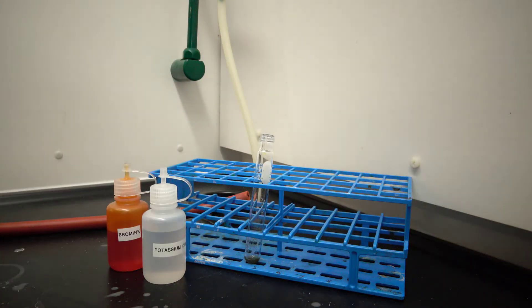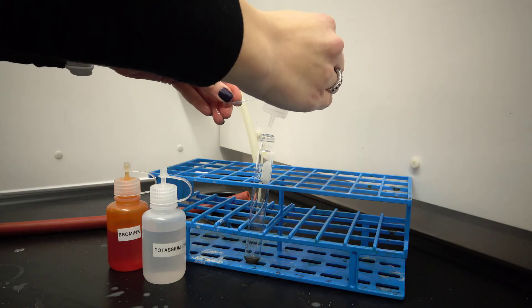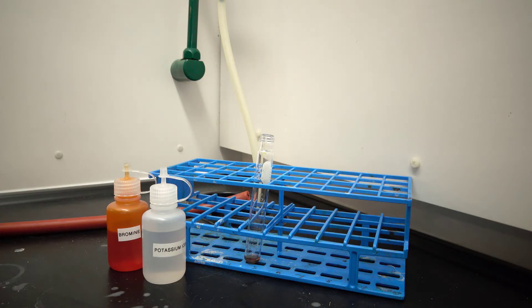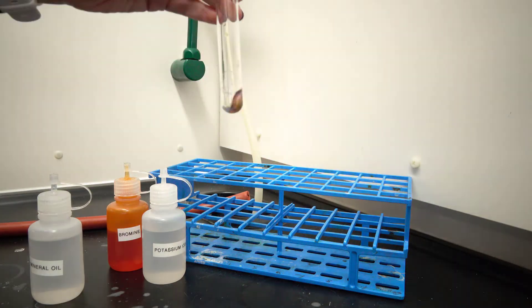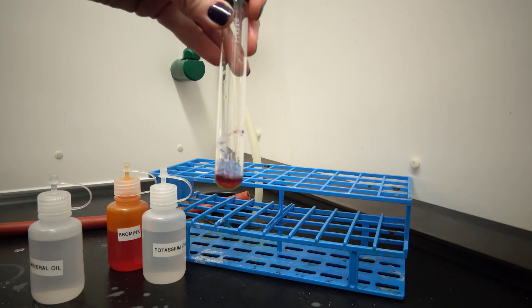Now remove the cap in the hood and add five to ten drops of mineral oil. Cap your test tube, shake it up, and now with the cap on you can return to your lab bench for observation.